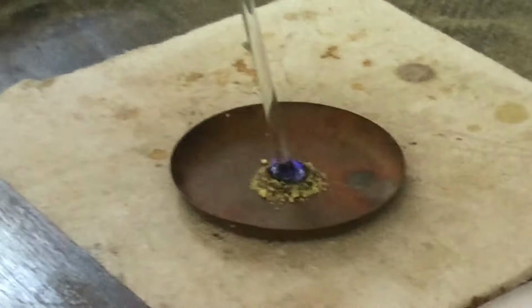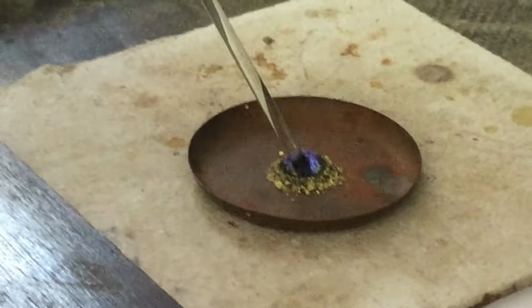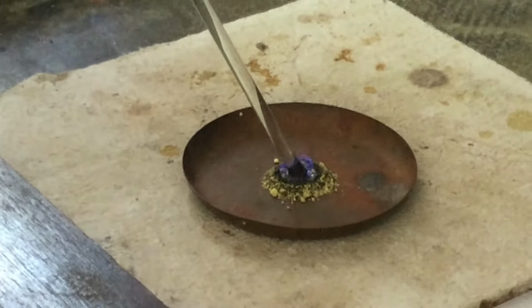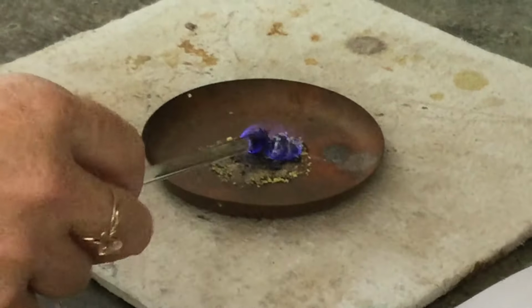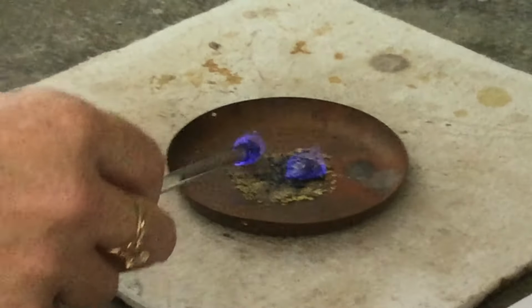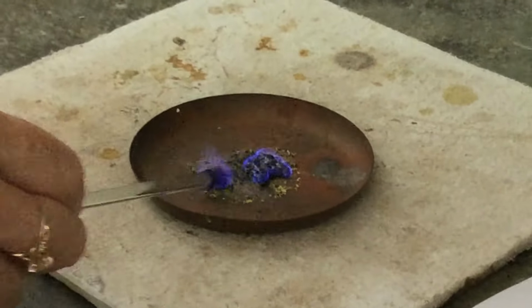But you can see now the chemical reaction starting to take place as the sulfur reacts with the iron filings. And what we're doing now is we're forming a compound. So I'm just going to move that into the fume cupboard. Now this is what's called, we're going to learn about them later, an exothermic reaction. And so when the reaction starts to take place, heat energy is actually given out.